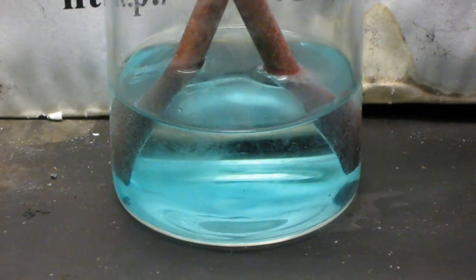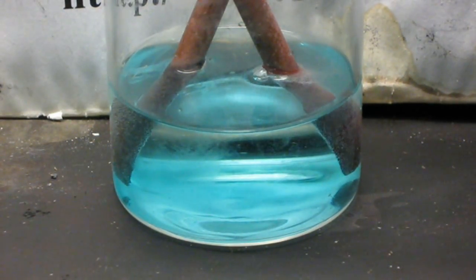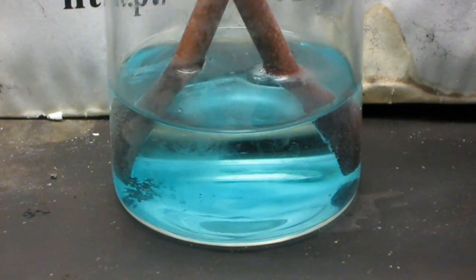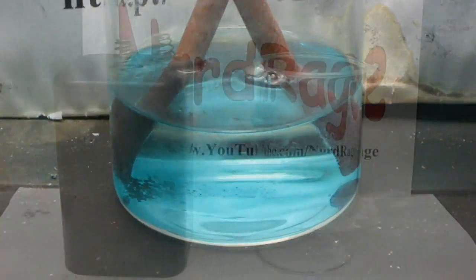This process as laid out is not very efficient. Because some of the copper ions being oxidized into the solution at the positive terminal is diffusing over to the negative terminal and being reduced back out of the solution. But there's actually a simple trick to get around this.